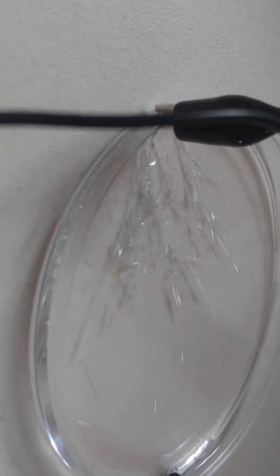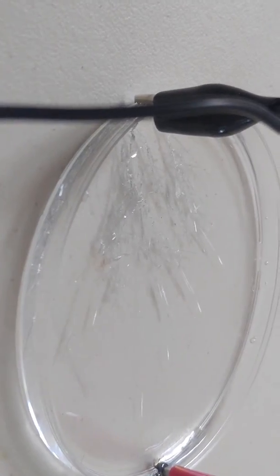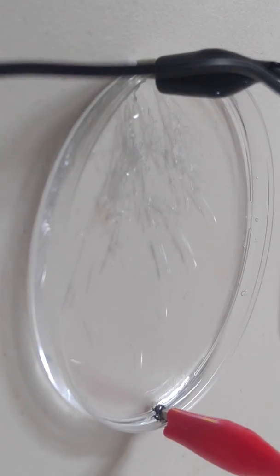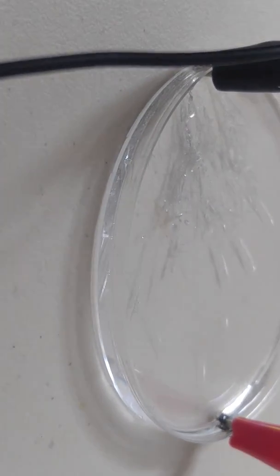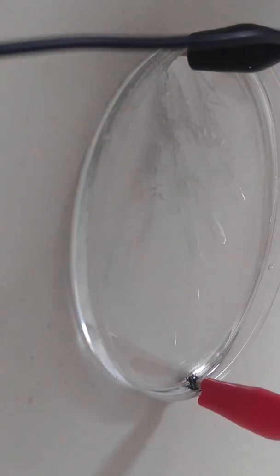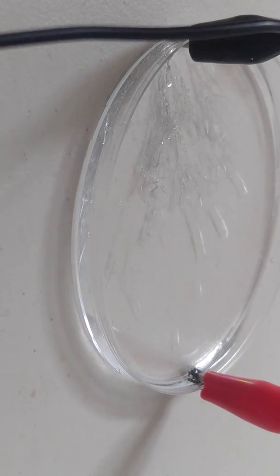There you go. Keep your face back, please. You can also tell because you can see the charred. You can see it's kind of charred a little. On the clip? Yeah. Yep. Weird. Oh, this is an electrochemical reaction. And they're starting to grow. They've grown up a little bit. Okay.